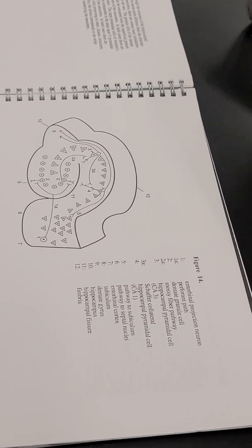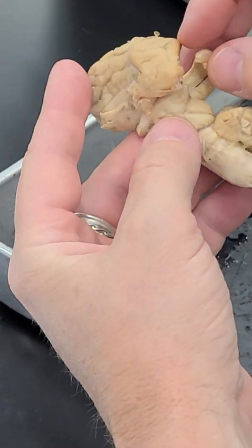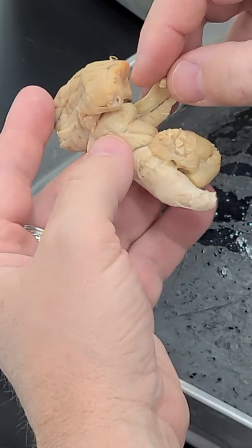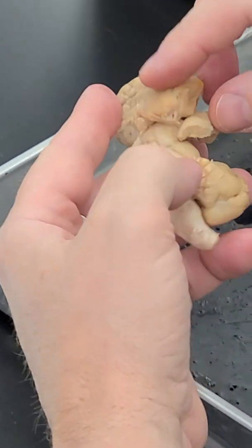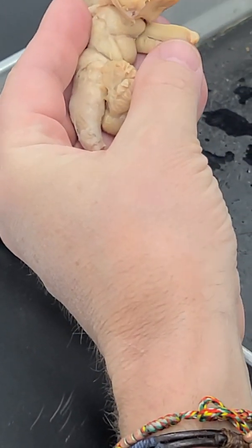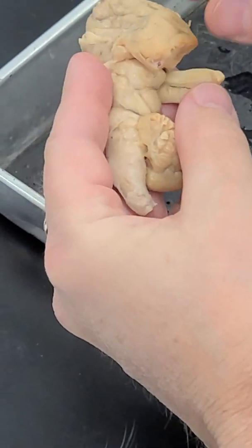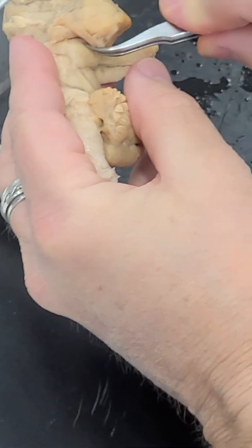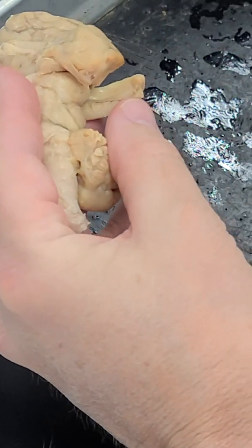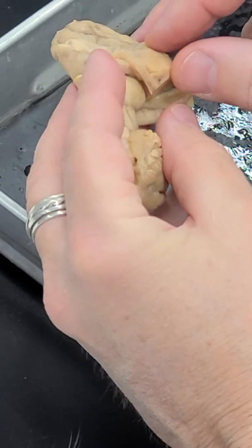Glutamatergic synapses. Now, the other thing I wanted to show you guys on this are some of the thalamic structures underneath that. And so, if we move the hippocampus out of the way, I want to do this without tearing it, we can see the midbrain, superior colliculus and inferior colliculus right here. And we can see the thalamus, at least the dorsal and lateral thalamus, up underneath the cortex. And there are 3 prominent bulges in this part of the thalamus.